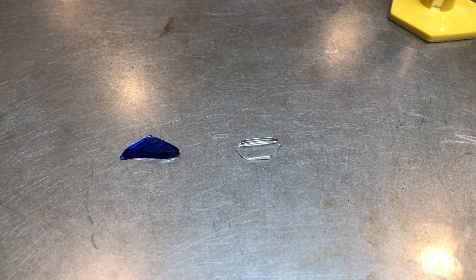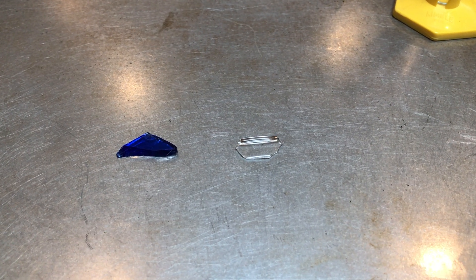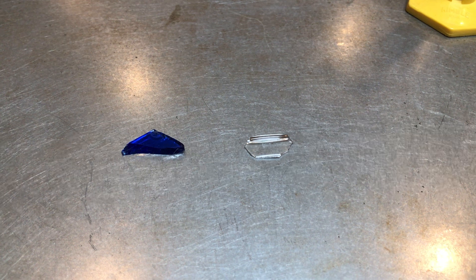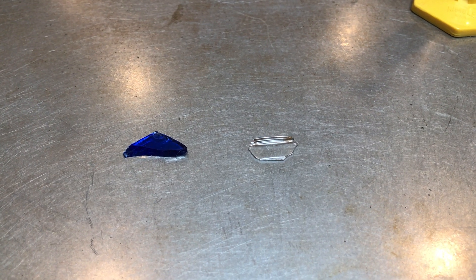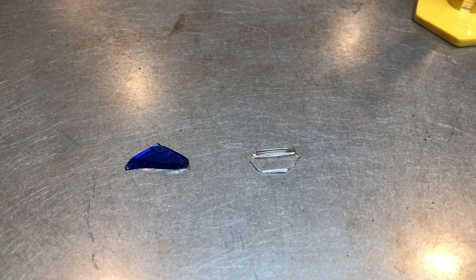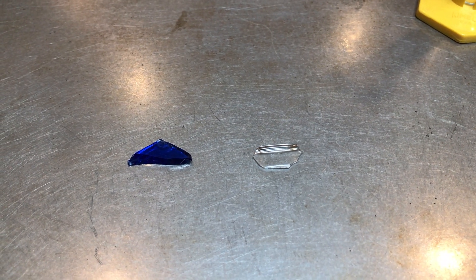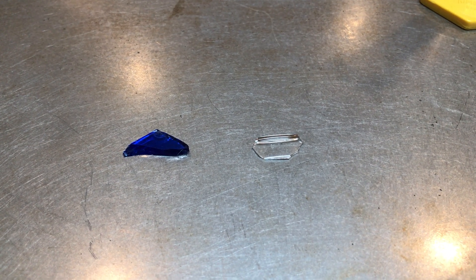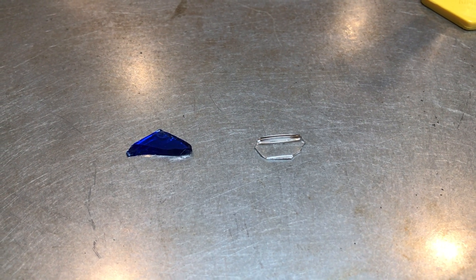Let's start looking at the physical properties of our two random glass samples. We have sample one on the left and sample two on the right. When we first categorize glass fragments, we want to go over their physical appearance. We'll notice that fragment one is blue.